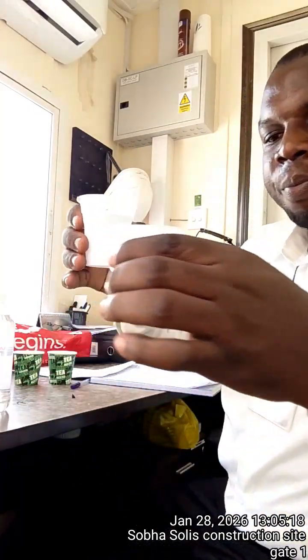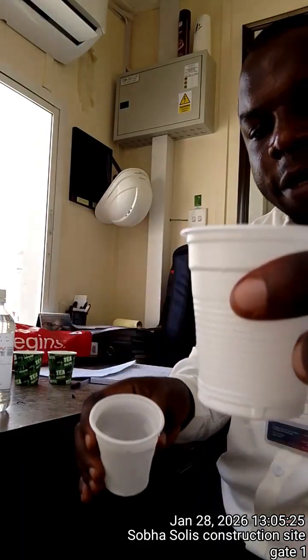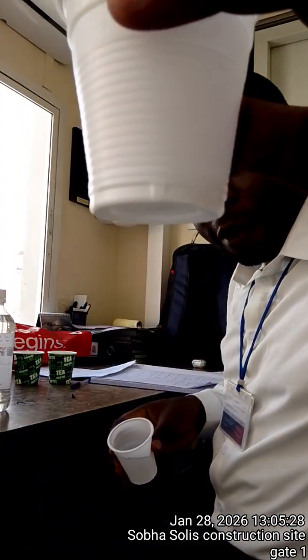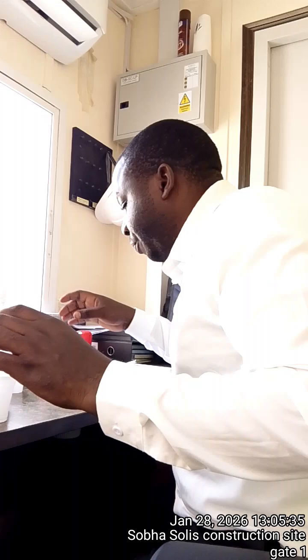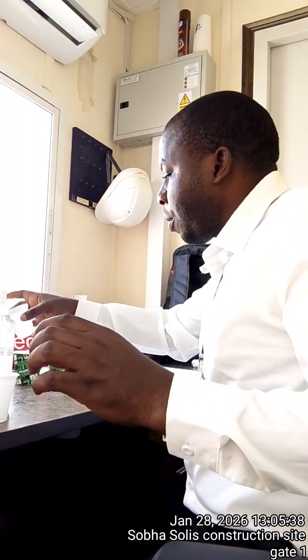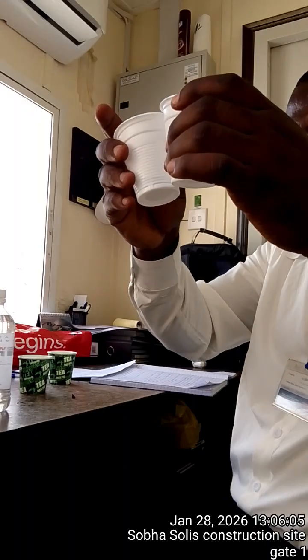So my work begins. I'll start by adding some small amounts of water. This is drinking water in one of the glass or cups. I have a plastic cup. Then I have this water also. So I've marked this one tap water. So this is our tap. So I've marked this one as tap water. So I'm going to add tap water here also, almost to the same amount.